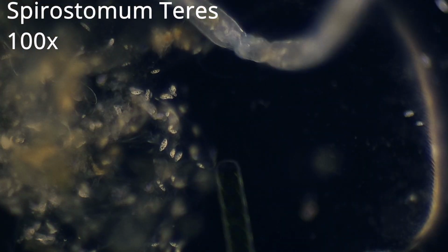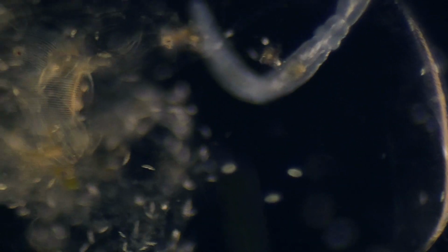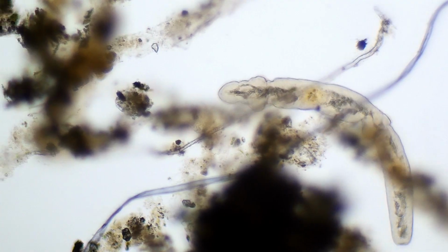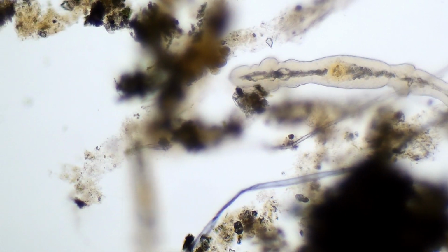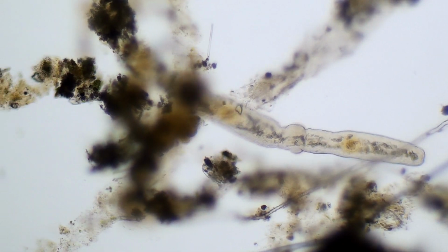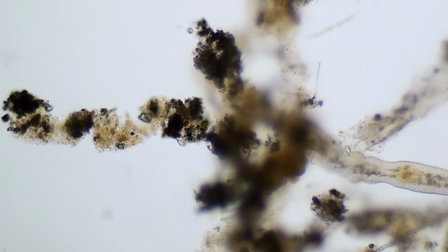What you can't see is their cilia and the grooves in their skin. A different type of illumination is needed for that. The cilia are a coat of small hairs, which move in a wave pattern, like the public at a soccer game. This causes them to move through the water.